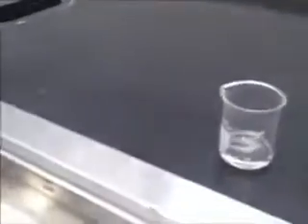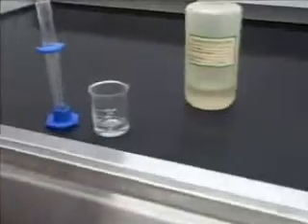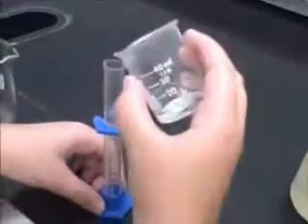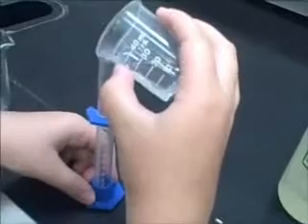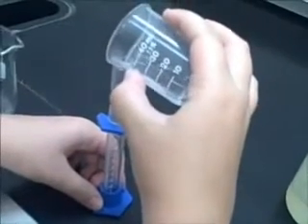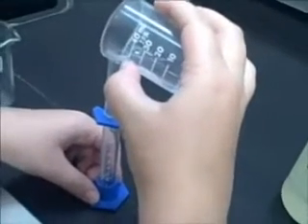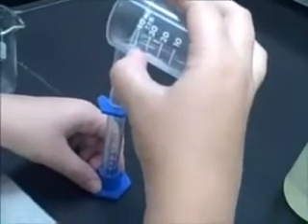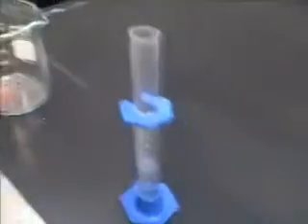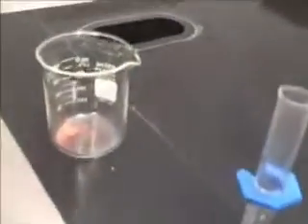We have nitric acid. We're going to measure out 5 milliliters of nitric acid. It doesn't have to be exact. Okay, we're going to add it to our copper.